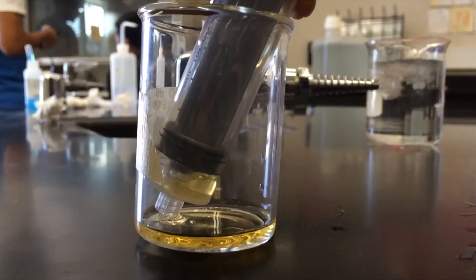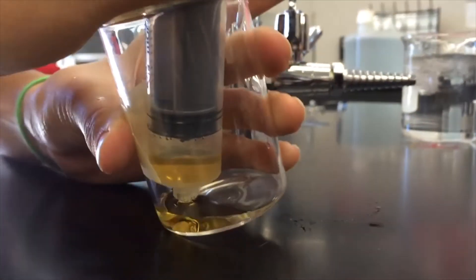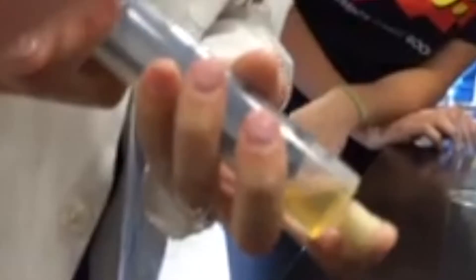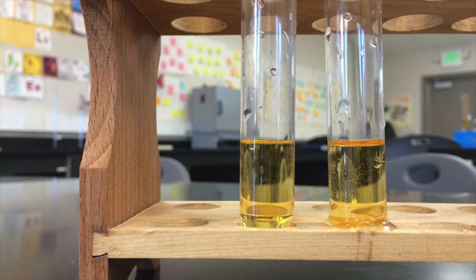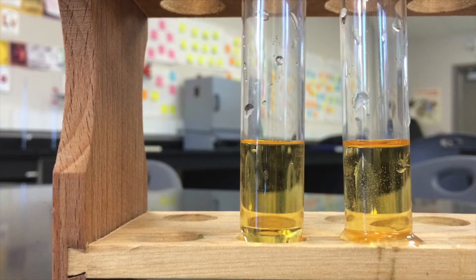Lastly, we altered the pressure of the experimental group by inserting all the experimental solution into a syringe. We pushed the syringe in to decrease the volume and therefore increase the pressure. We also pulled the syringe back in order to increase the volume and decrease the pressure. Once again, there was no change between the experimental and control.